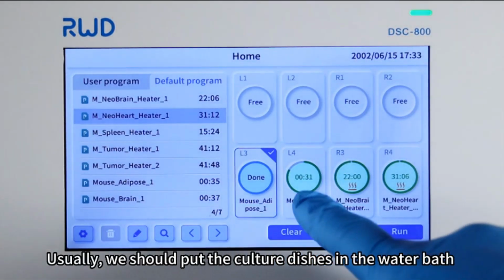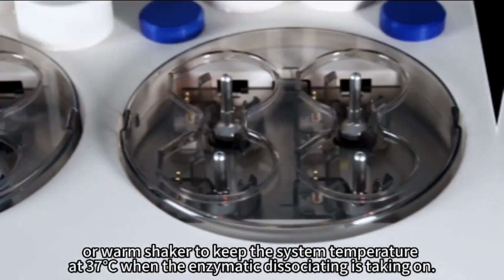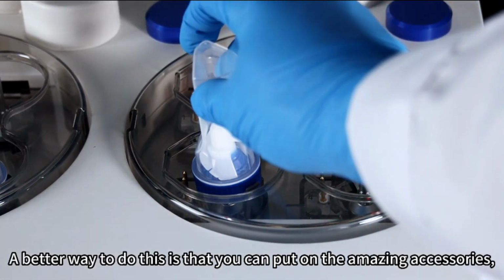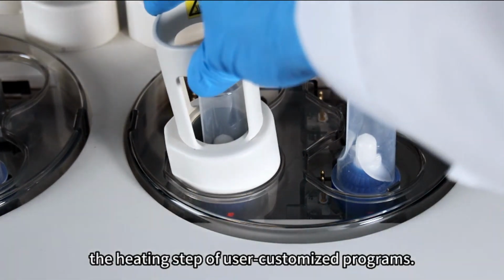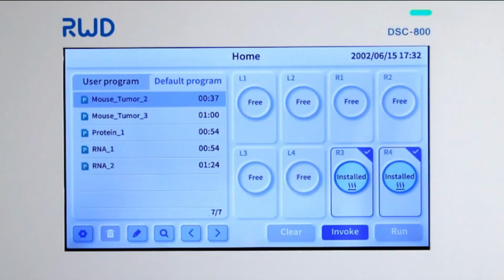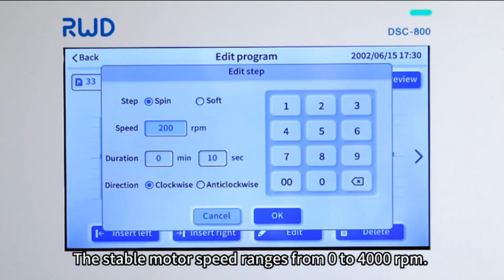Usually, we should put the culture dishes in the water bath or warm shaker to keep the system temperature at 37 degrees Celsius when the enzymatic dissociating is taking on. A better way to do this is that you can put on the amazing accessories, so that you can select the built-in programs with the heating function or turn on the heating step of user-customized programs. The stable motor speed ranges from 0 to 4,000 RPM.